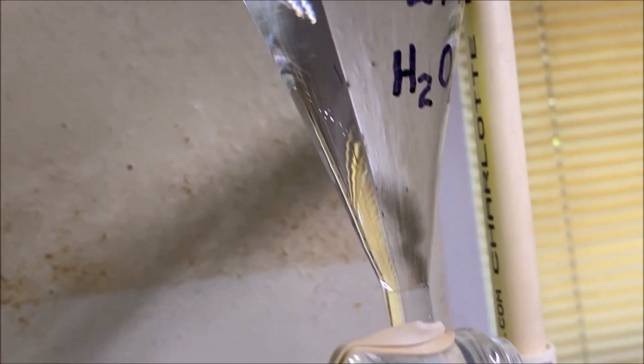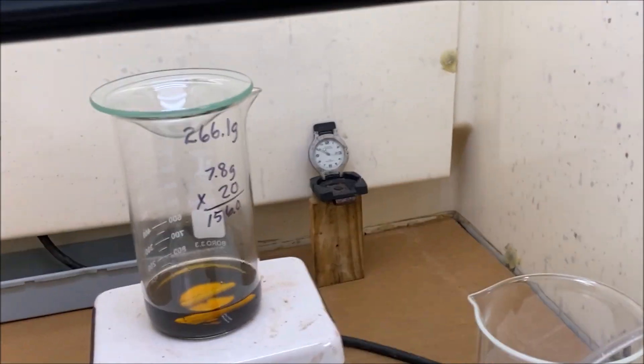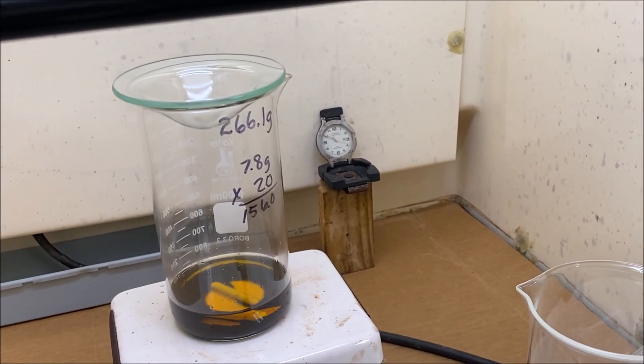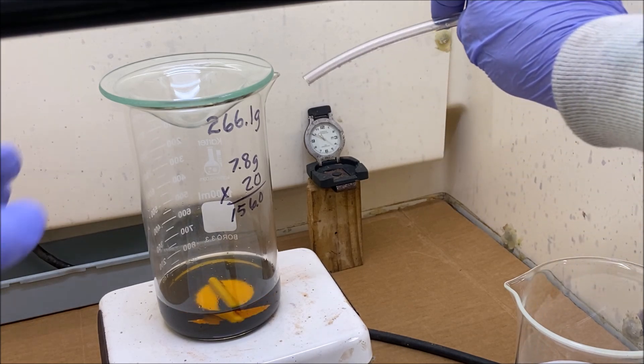I've got my funnel set up outside of the fume hood so I don't have to be in there with it. So now what we're going to do is insert our delivery tube into our reaction beaker.